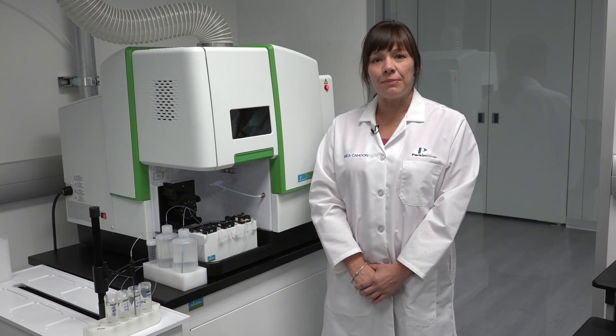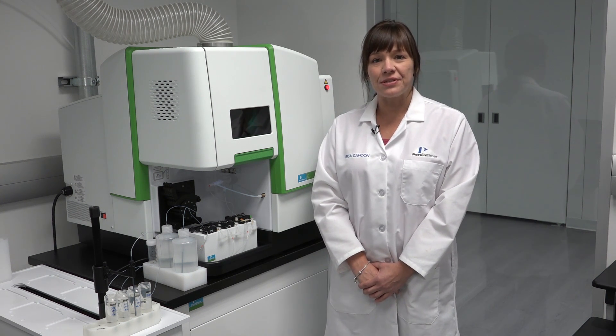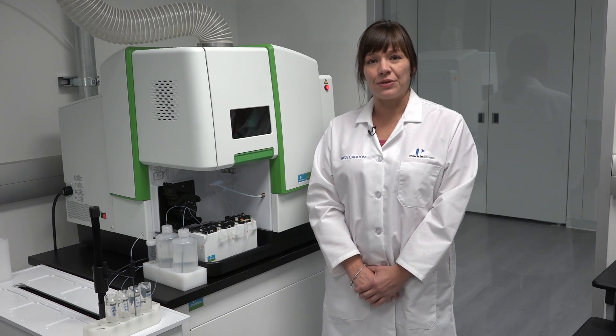This reduces user error, helps to eliminate possible sources of contamination, and saves valuable time in the laboratory.